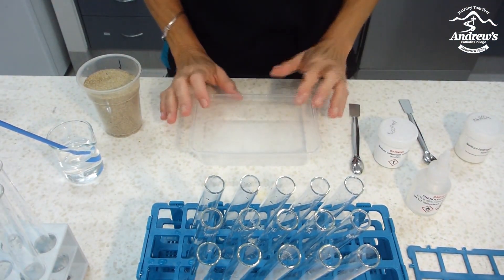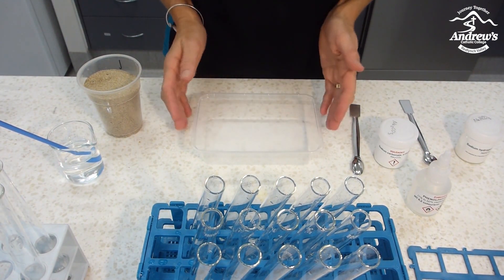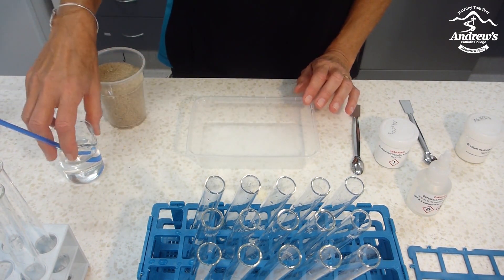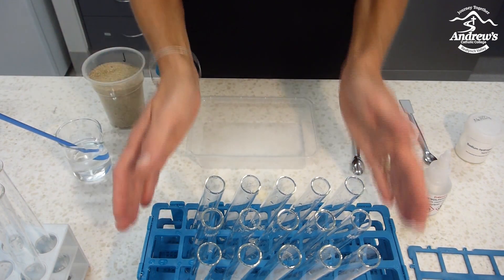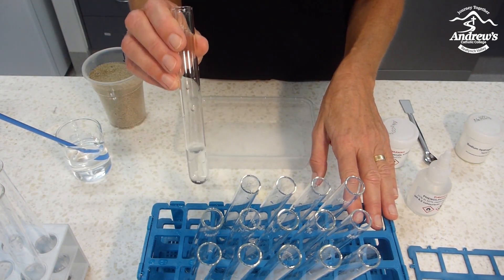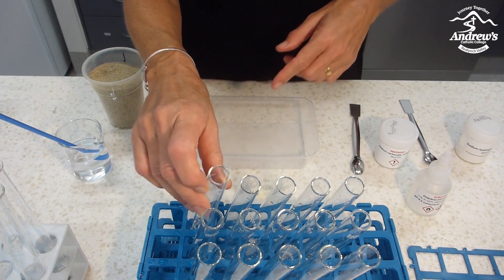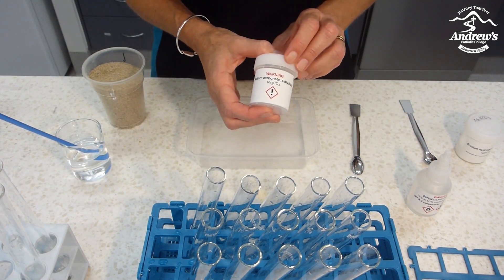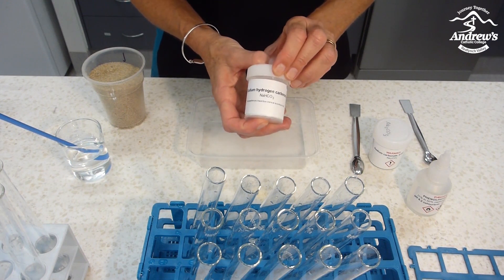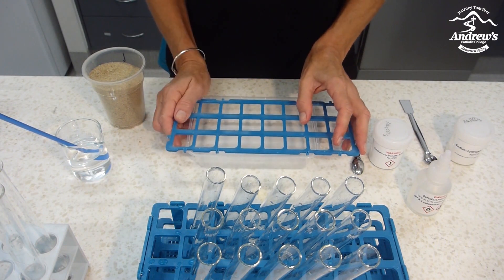I'm going to prepare an experiment to simulate a geochemical survey. What we will need is a tray — just a take-away container — some sand, a straw in water, and a set of test tubes. I have already put about 5 ml of water in these test tubes and added one drop of phenolphthalein indicator. We also need sodium carbonate and sodium hydrogen carbonate, and a grid that will fit on top of the container.